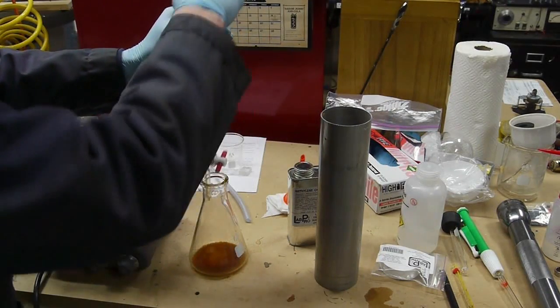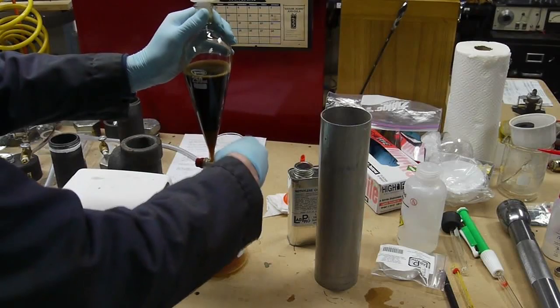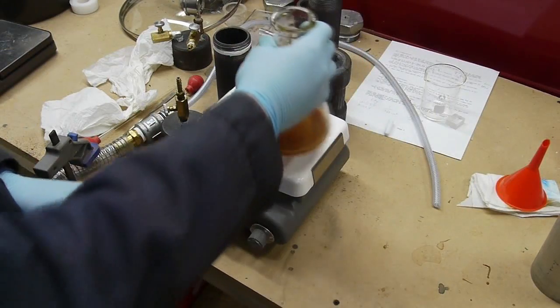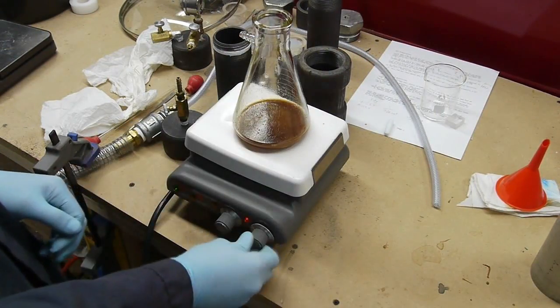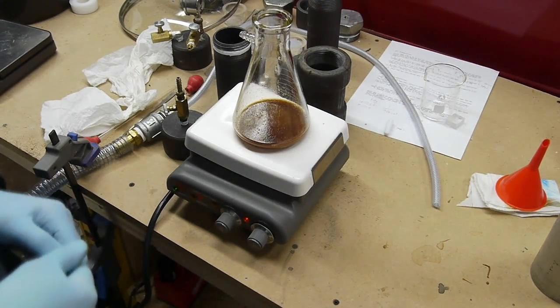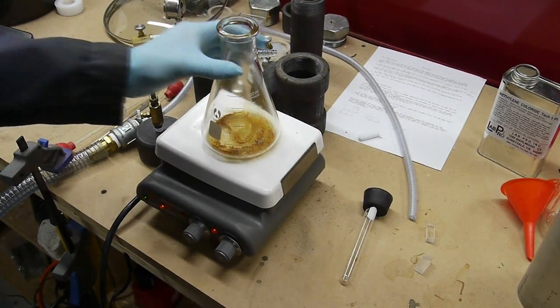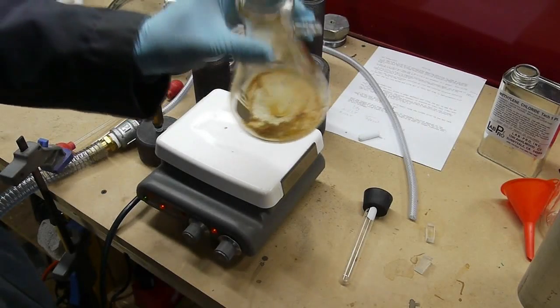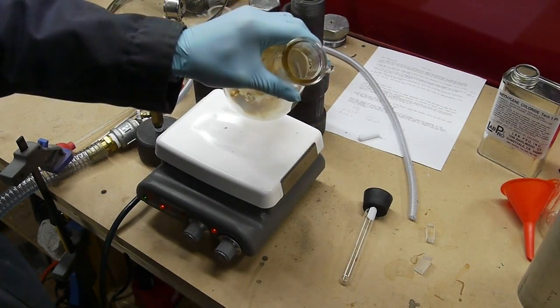Now there'll be some impurities, of course, because other substances in the coffee water are dissolved into the methylene chloride as well.